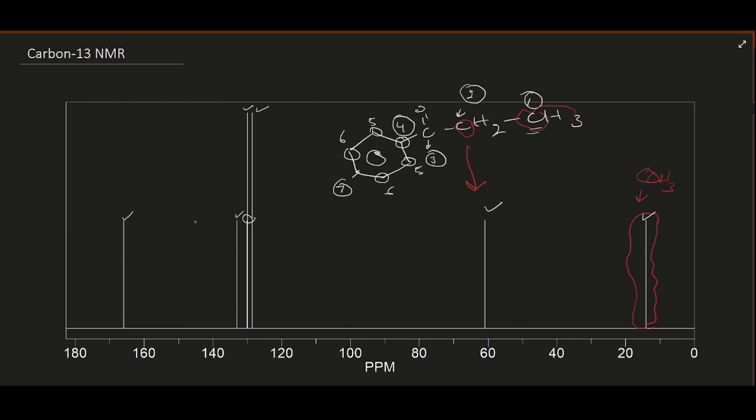The important thing I want to tell you is that the carbonyl carbon will appear as an ester. Oh, there is a mistake, this is the ester molecule, so there is a single bond O, yes, there is an O group. This is ethyl benzoate. So the ester group carbon will appear at 160 to 180.